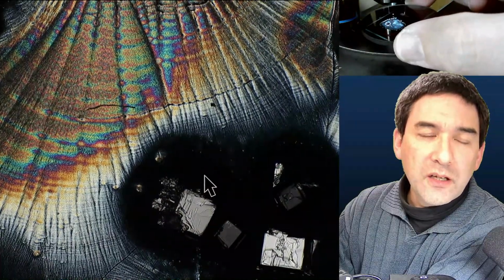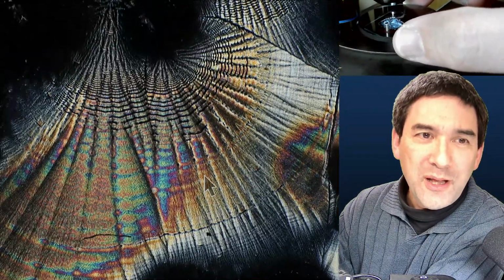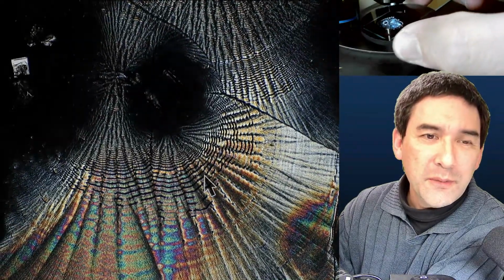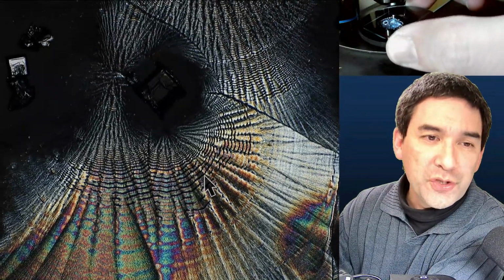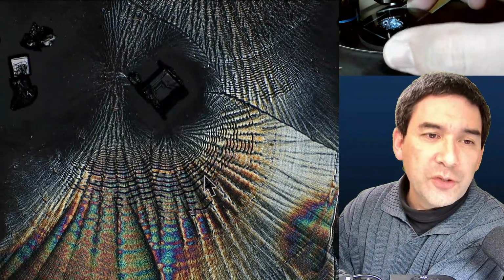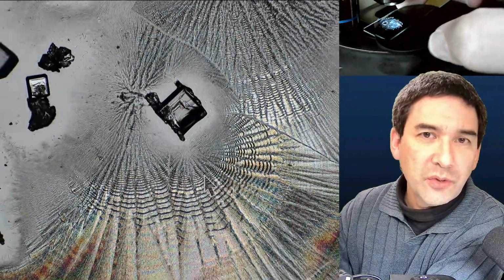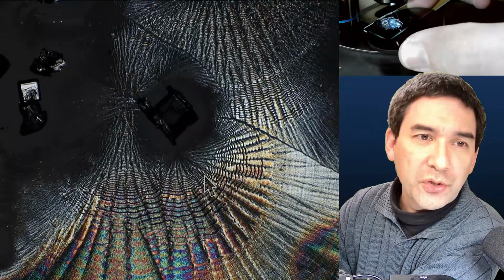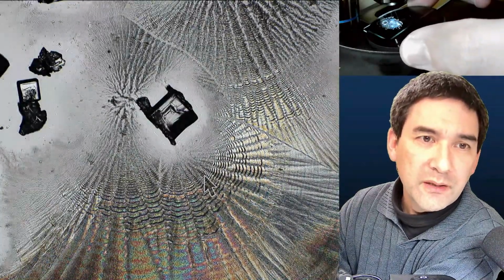By using this cross polarization, it looks different than with my built-in polarizer, because there are some other optical elements in there as well. I've got this technique called DIC, which also uses polarized light, but is different than just using crossed polarized filters. When you turn it again, you see that the background starts to light up, or you can also turn the one over the lamp like I'm doing right now. So there are plenty of things to experiment with.